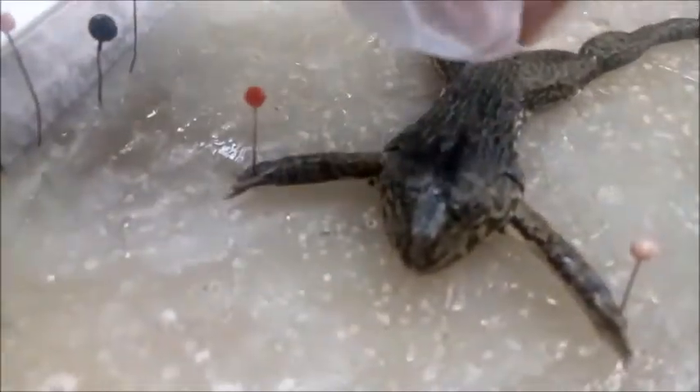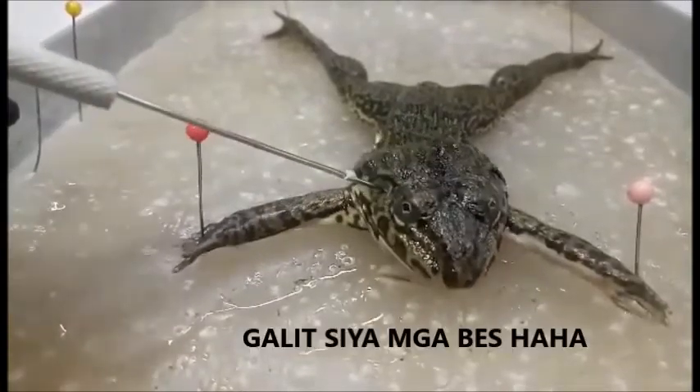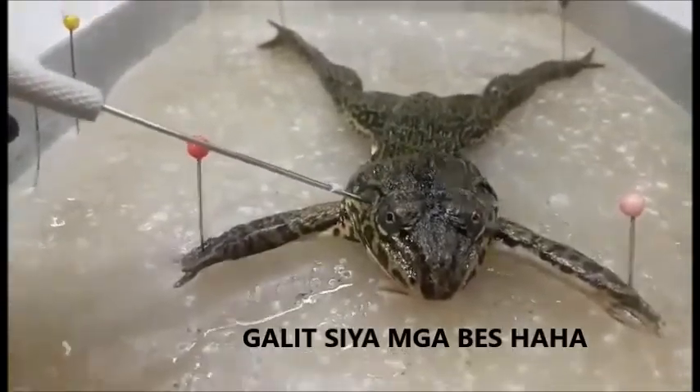Let's take a look. This is what we want to observe. Let's go over what we know about the external anatomy — you're going to see it, and I'm going to point it out.